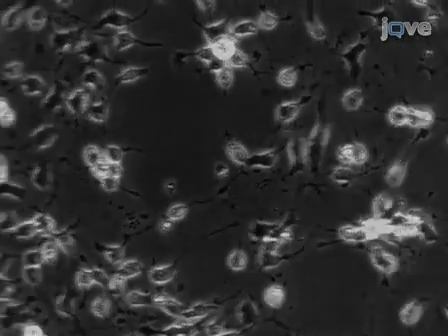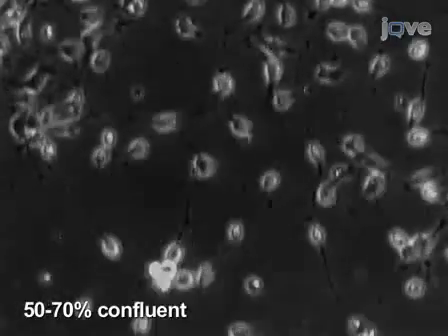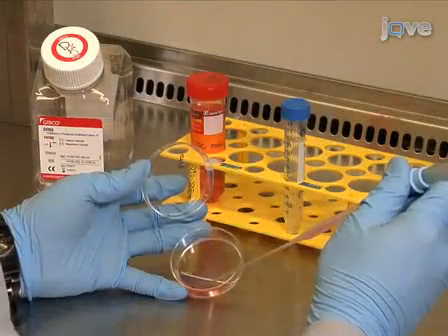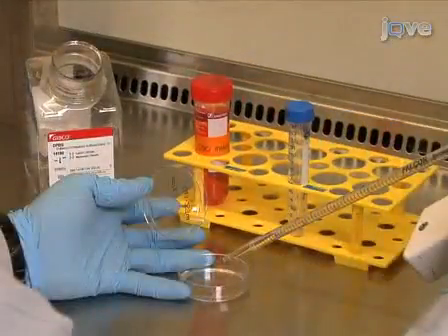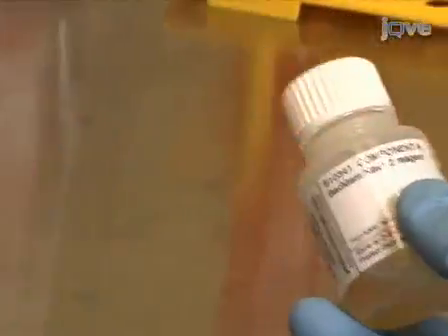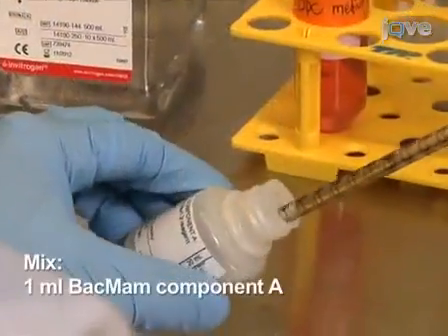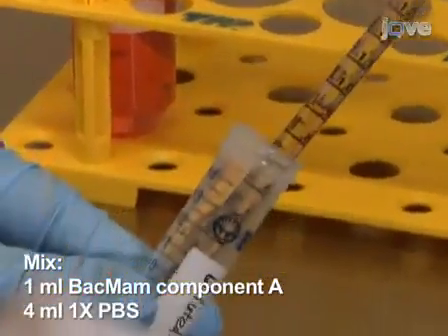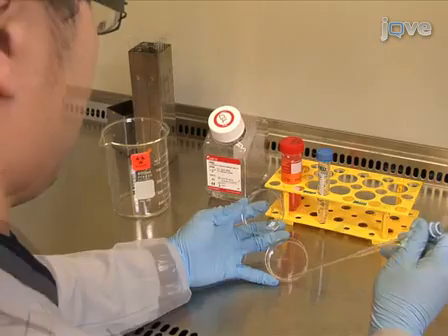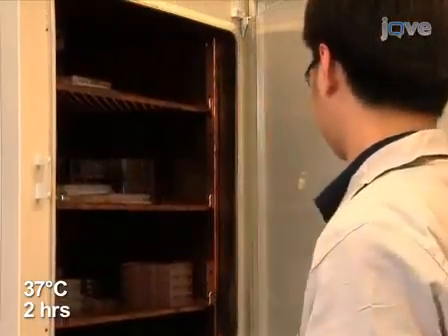To generate spiking OPCs, use mouse ES cell-derived OPCs that are between 50 and 70% confluent. Exchange the medium for 1x PBS to rinse the cells. To introduce voltage-gated sodium channel 1.2 alpha subunit, we use the BacMam sodium channel kit. Mix 1 ml of BacMam component A with 4 ml of 1x PBS. Remove the PBS rinse, and add the diluted component A. Incubate at 37 degrees Celsius for 2 hours.